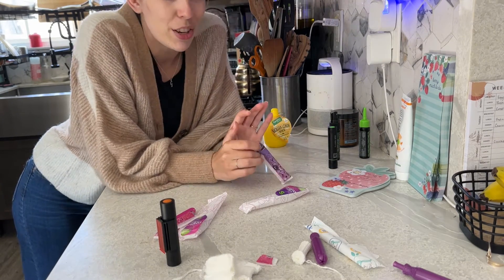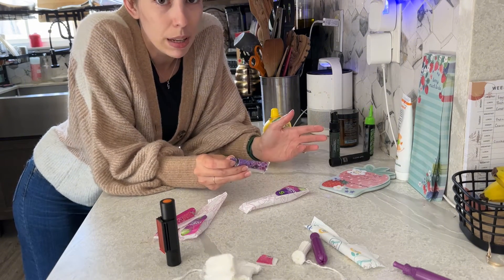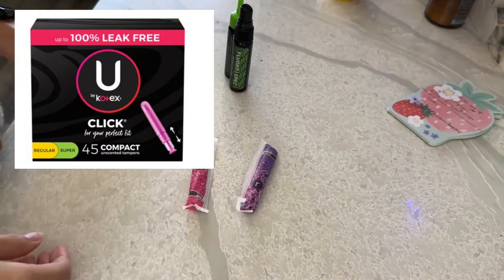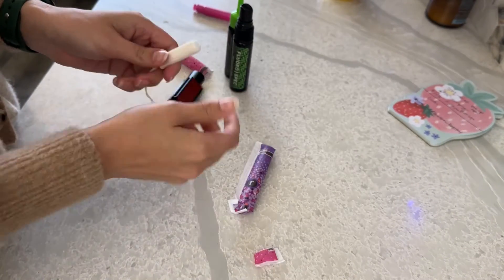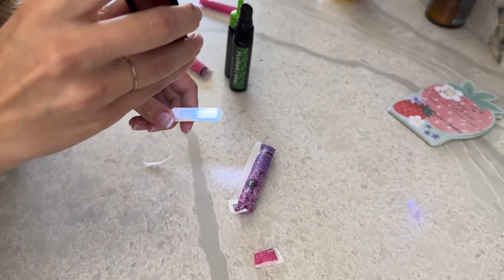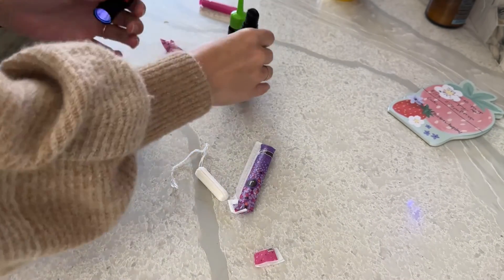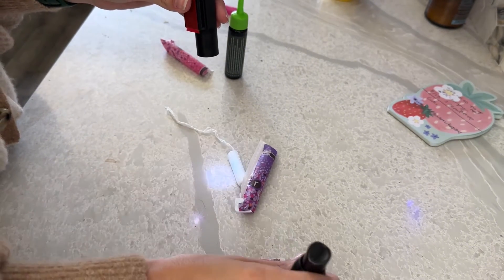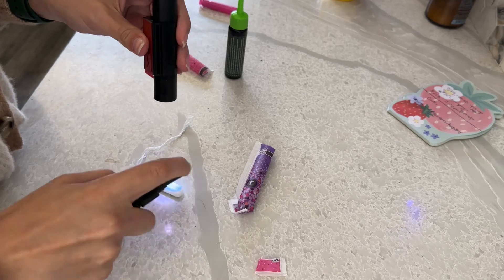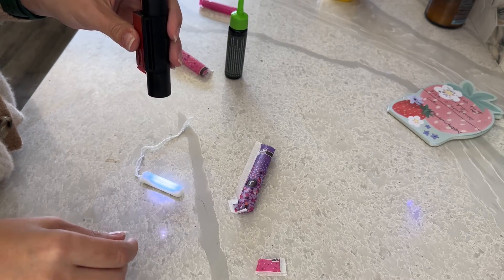I make sure to open them and then do a full cut, so you're going to have to wait because I'm not cutting the video. The first brand we have is U by Kotex. So here's me opening them, taking them out. I'm shining the light on it beforehand and nothing is glowing, which is a good sign that anything that does glow after this would be because it's lead. So I spray the indicator liquid on it. I can't really see anything as I'm spraying — also a good sign, I think.